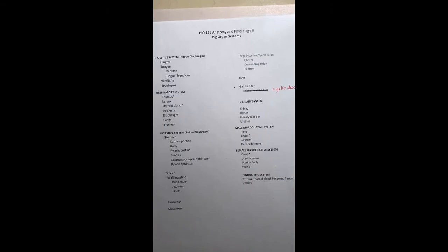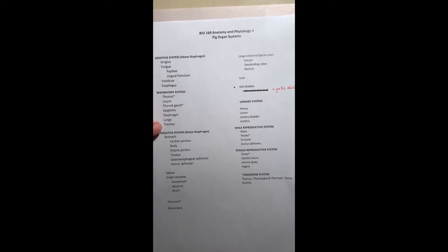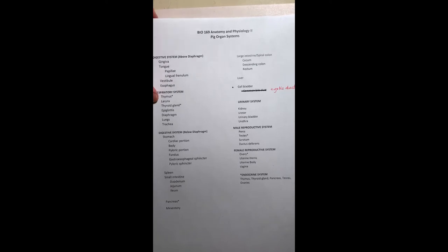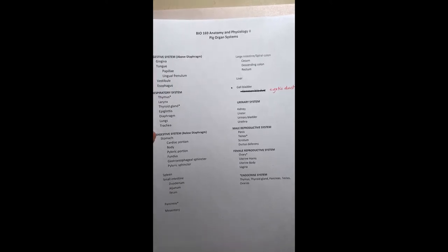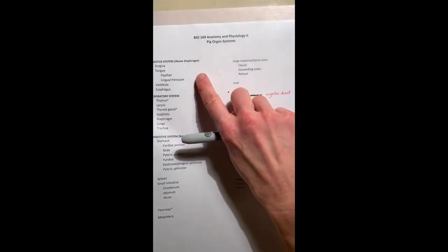We're going to start with the digestive system here above the diaphragm, meaning we'll be in the oral cavity, and then we'll go down to the respiratory system and end at the lungs and trachea. Then we'll look at the digestive system and move on to the organs below the diaphragm, beginning with the stomach. So let's do the digestive system above the diaphragm.